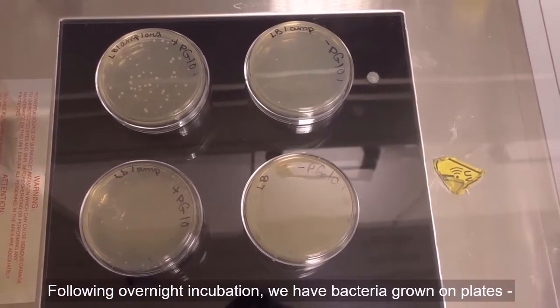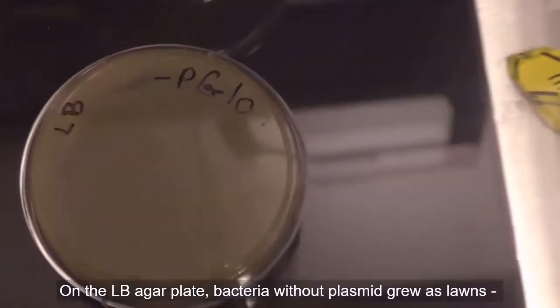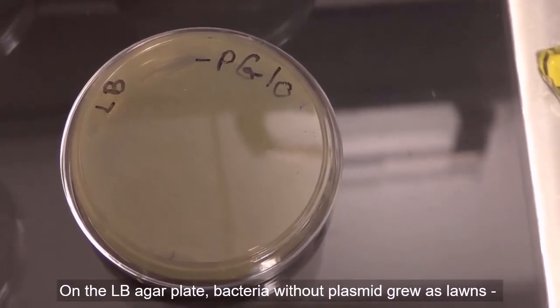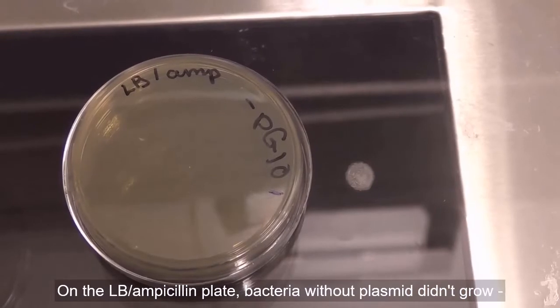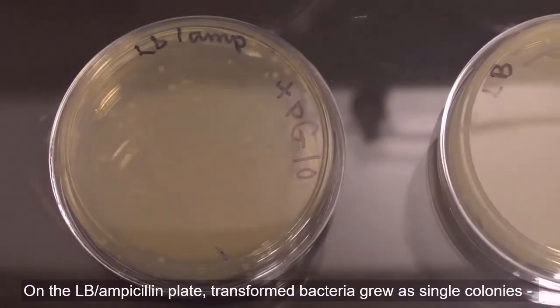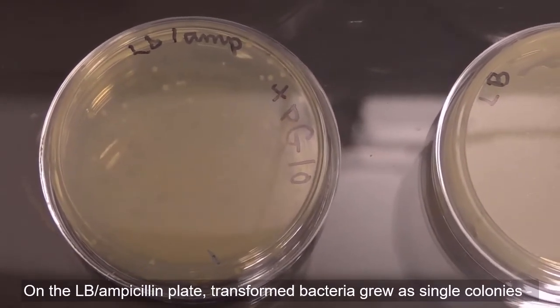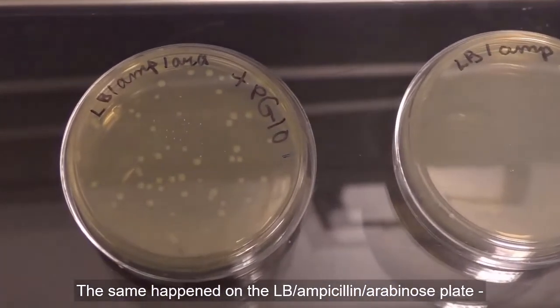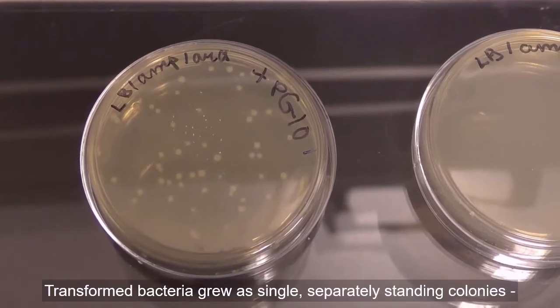And if you look at the LB agar plate with bacteria not transformed on them, you could see them growing as lawns or smear. Now look at the LB ampicillin plate with the non-transformed bacteria, which did not grow. The LB ampicillin plate with transformed bacteria grew as single colonies, and the same happened for the LB ampicillin arabinose plate, where the transformed bacteria grew as single separate colonies.